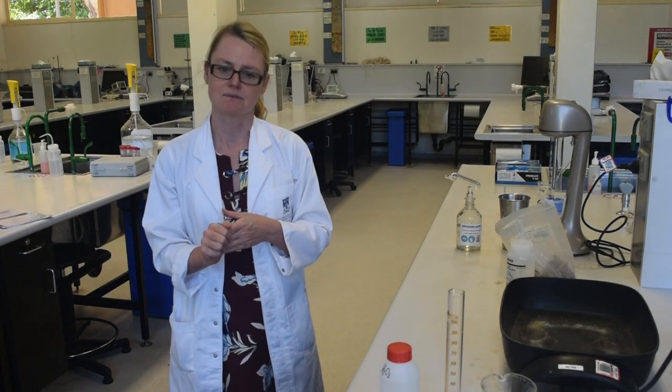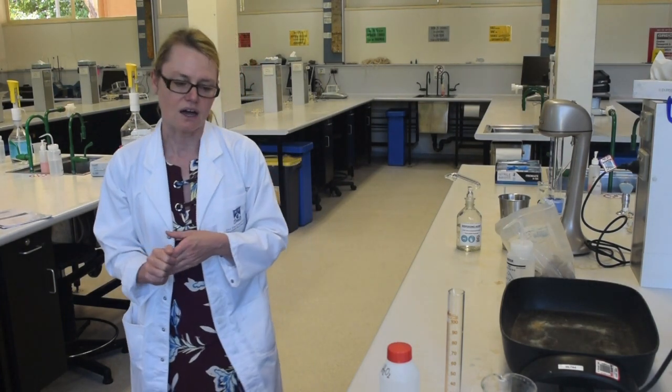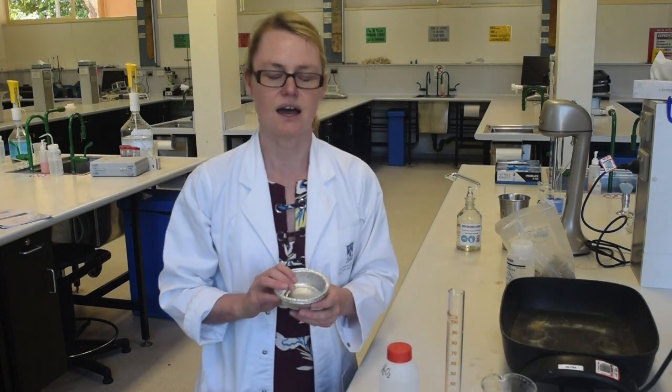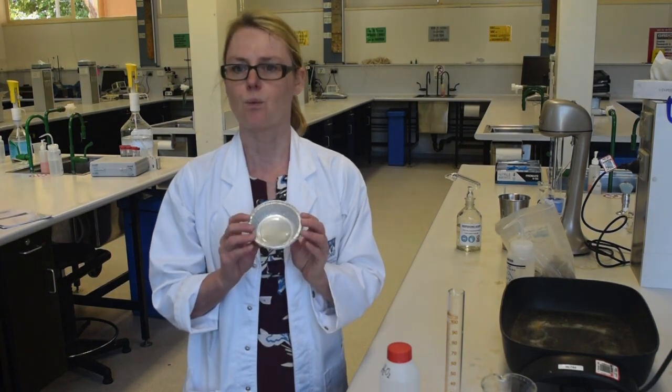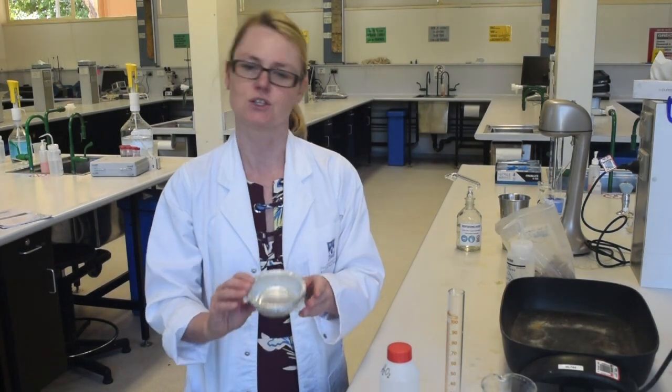So what are the key pieces of equipment needed? First of all you're going to have to weigh your soil sample using a balance that you've checked is level, and recording the weight of your soil sample that you have weighed into your aluminium tins.